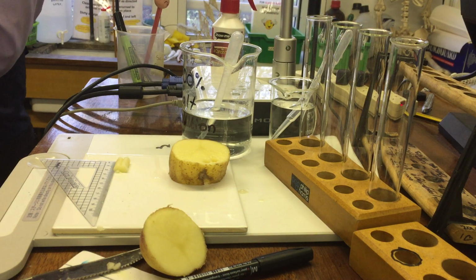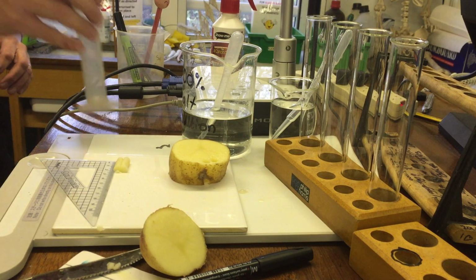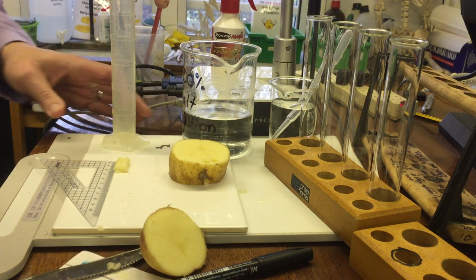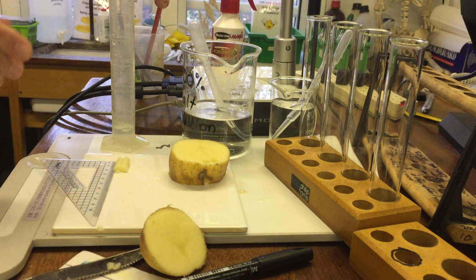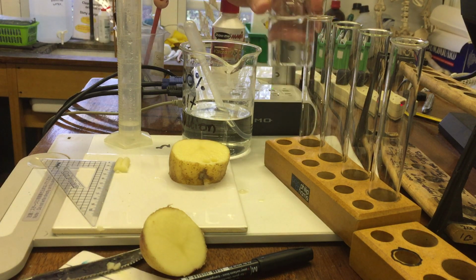And you're going to need a measuring cylinder. And to save time, you can just mix it in the same measuring cylinder. You can just take your 5 millilitres of salt, use a pipette to help measure it out. And you'll know you've done it right, because if all these tubes are the same, they should all get to the same level. Groups that have done it wrong, have not followed the instructions, will end up with tubes of all different heights.